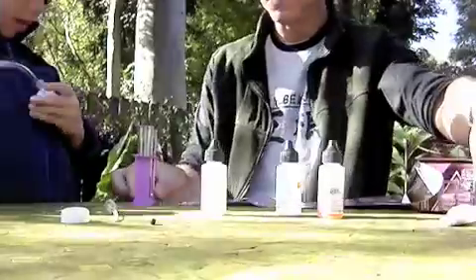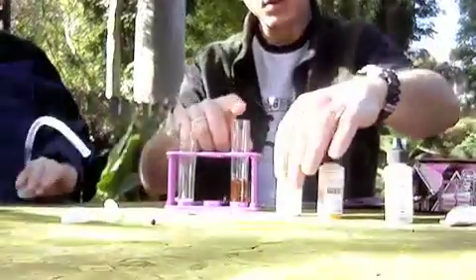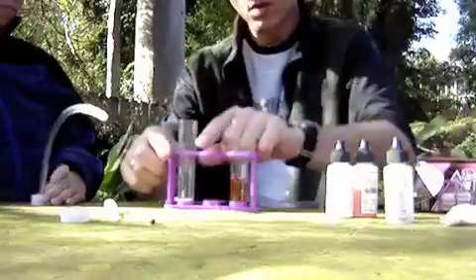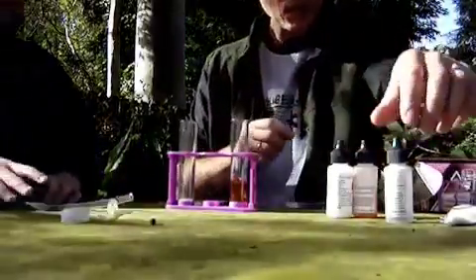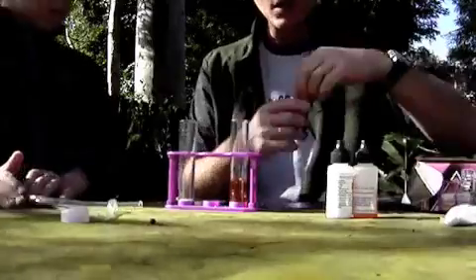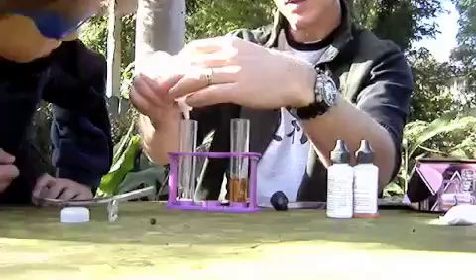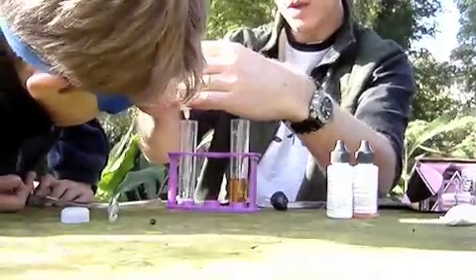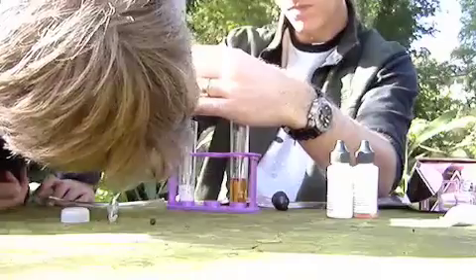All right, just to review: we've got some bicarbonate indicator in this test tube, we've got some marble stones in this one, and now we're going to put some citric acid in with the marble. Citric acid is a clear solution — it's a white liquid.